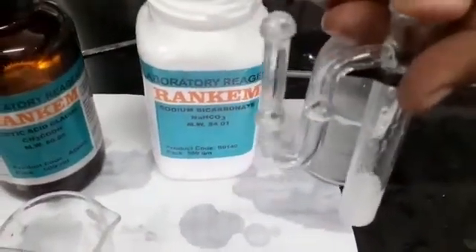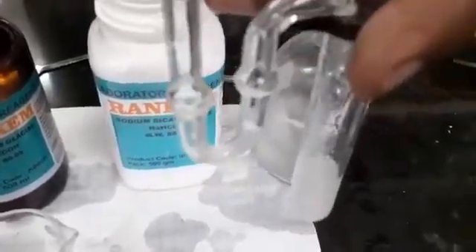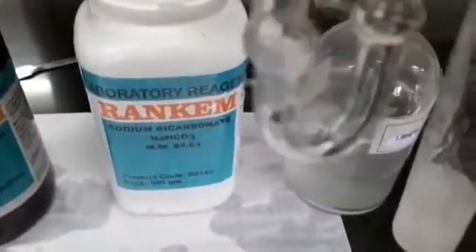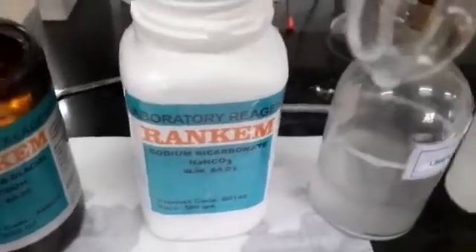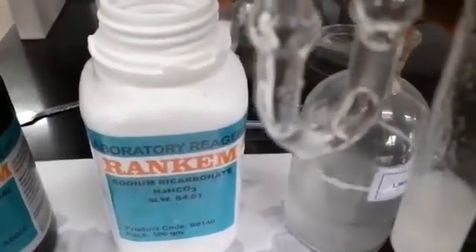Now this gas is passing through the lime water. See the change - the lime water has turned milky. The color has changed. See here in the U-tube.